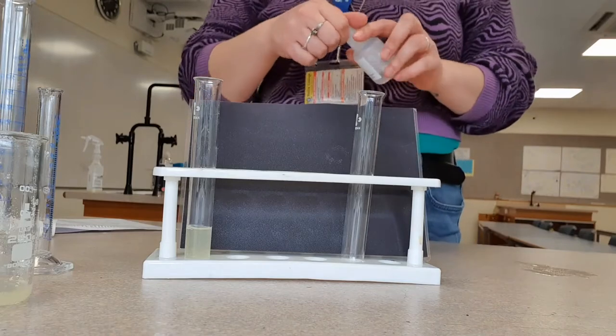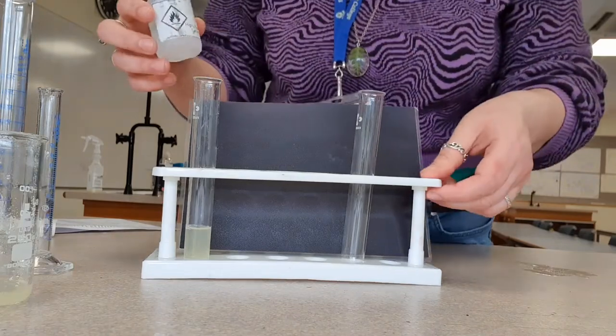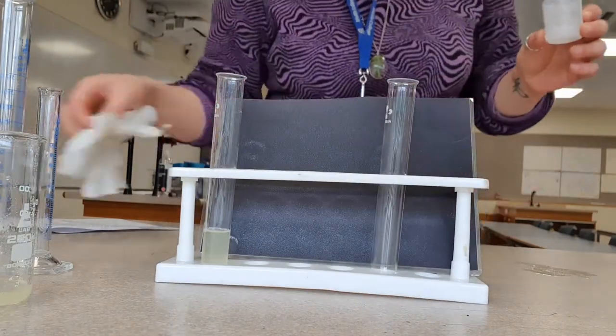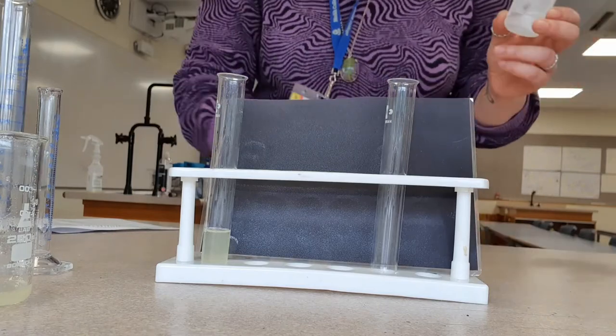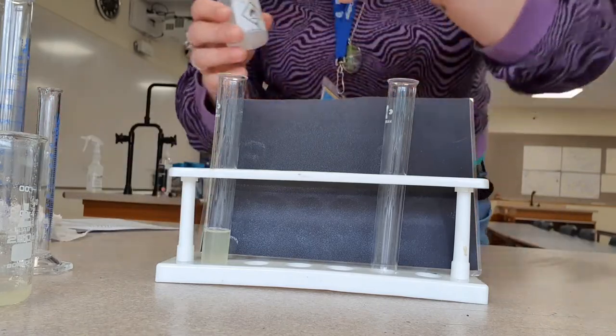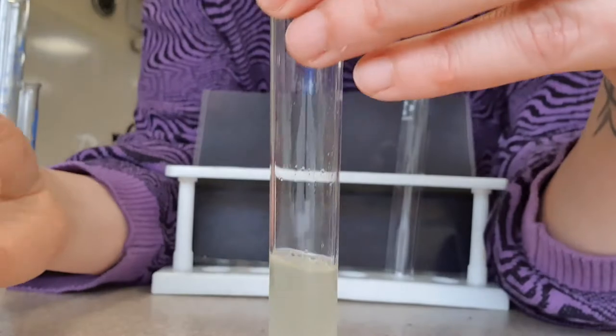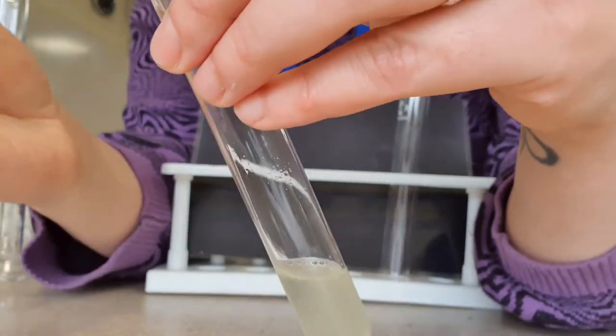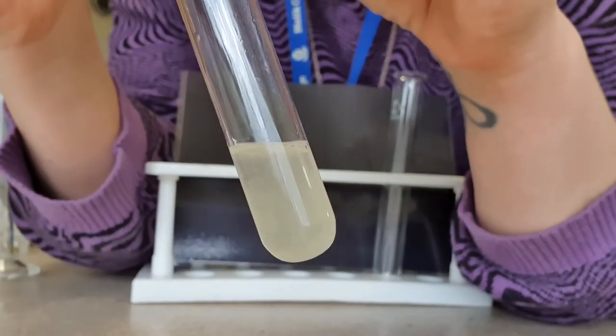The part that actually extracts the DNA or precipitates it out. Do you know what precipitate means? No? Look it up. I'm going to gently squirt this on top so it forms a layer. Now you can watch it.